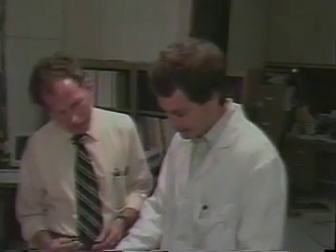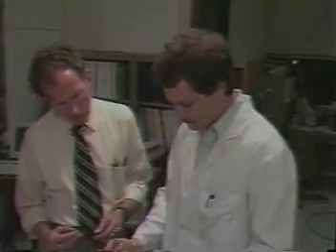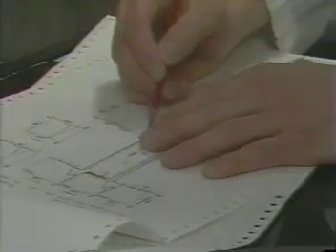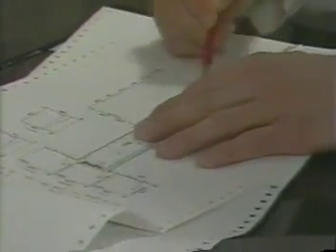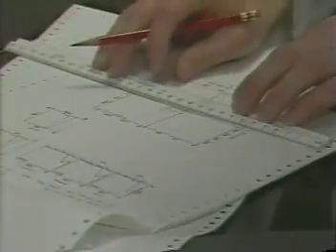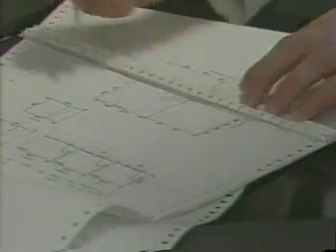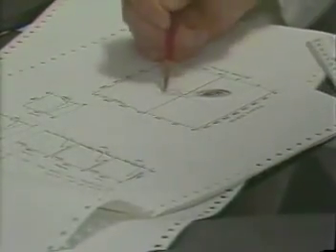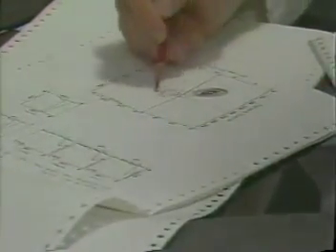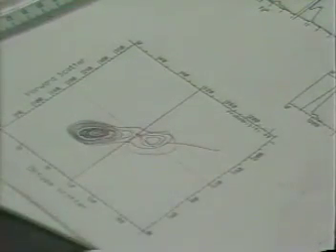Right. And I think now we can do some nice gating on our cells. These large cells by side scatter and forward scatter, they're our monocytes. I guess we can just gate those out. Right. The side scatter does a fairly nice job of delineating that population of cells. I think that represents about 10% of our cells, but I'd like to just home in on our lymphocytes here and see what these distributions are like. It should be pretty interesting.